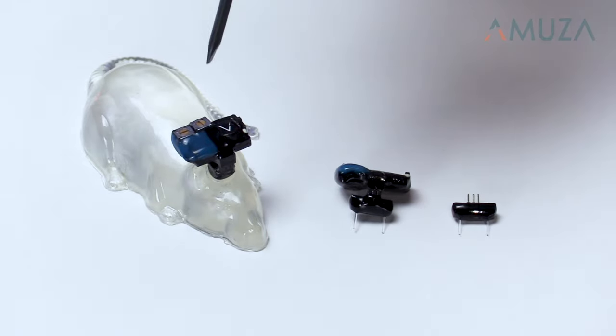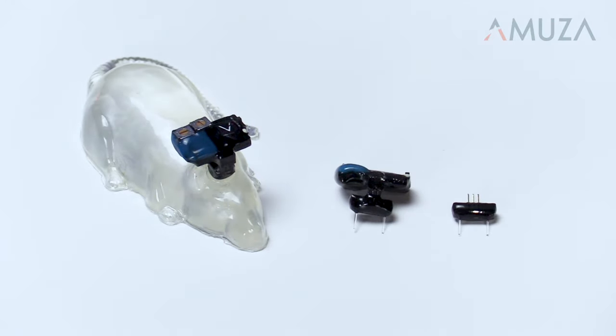You can adjust the light power with a screwdriver. For two-channel receivers, the power for each channel is adjusted independently. This way you can make certain each mouse or rat in a group receives the same irradiance at the target.